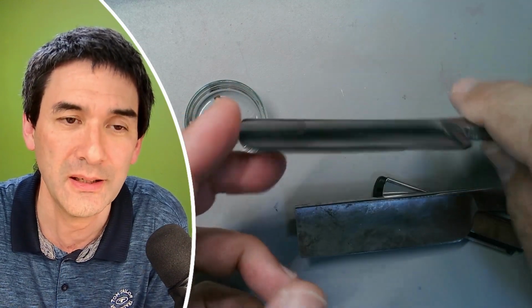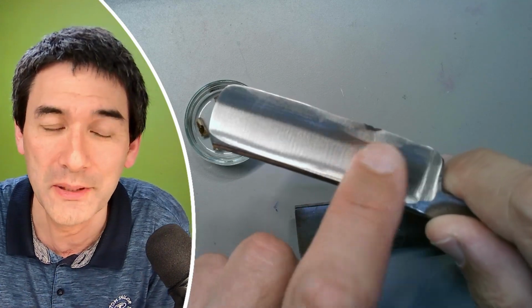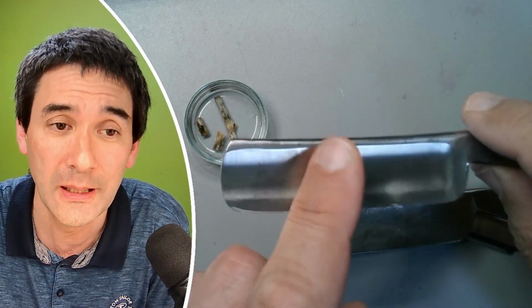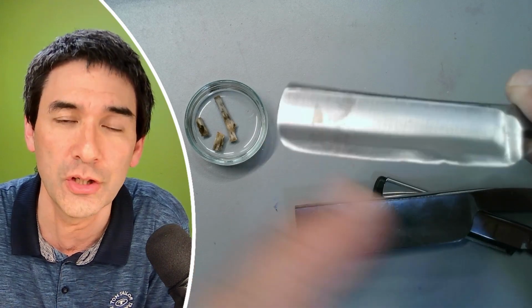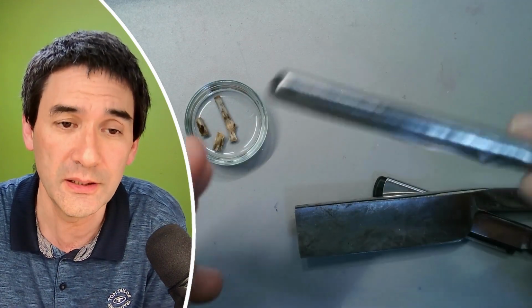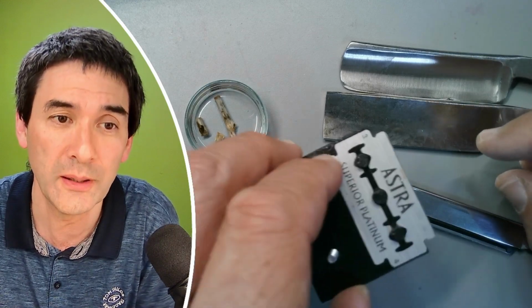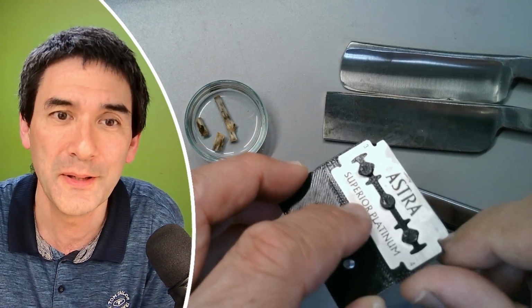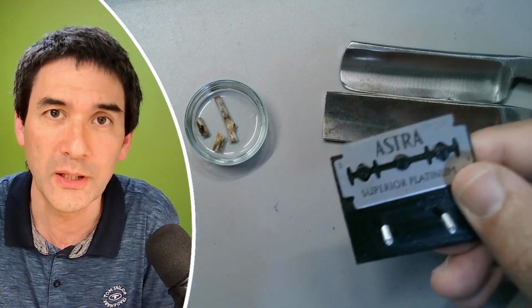I mean, this is pretty bad. Yeah, so this is not something that I made, but actually came like that. Yeah, it's probably going to be pretty useless. It's not even smooth, the edge here, but we're going to see, right? As a matter of fact, I can already tell you right now, my favorite one up to this point is this one over here. It's able to produce quite good results, but I have to put it together first.